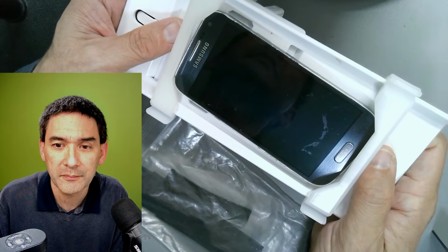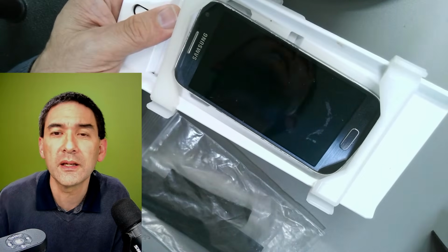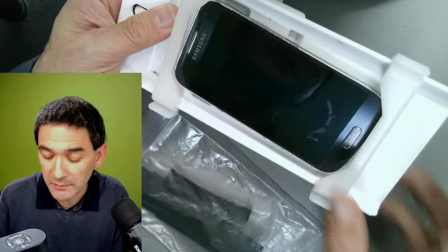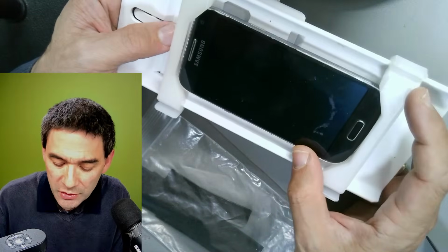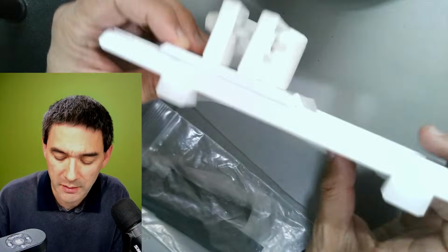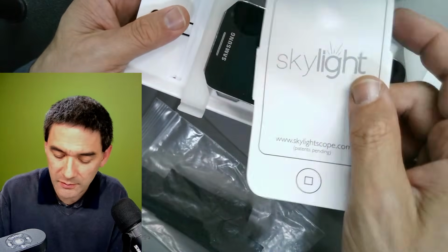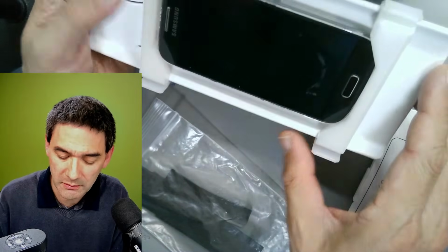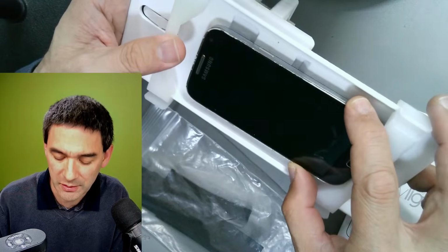Okay. So I'm quickly checking again. Yeah. So again, because you're talking about 3D printers, I think 3D printers might actually be a solution here as well. But that is basically this skylight system, and yeah, it's a little bit large, and also maybe not the most stable solution.